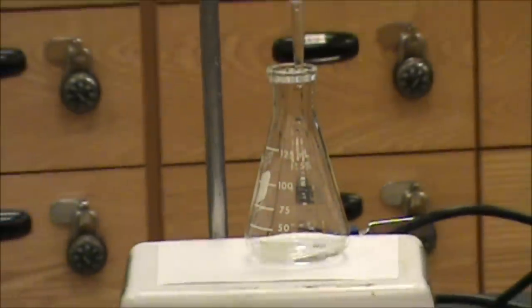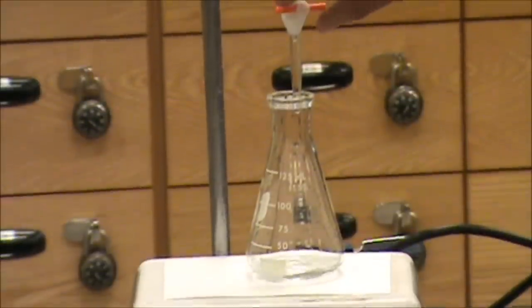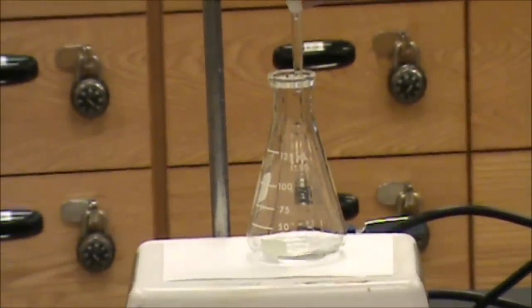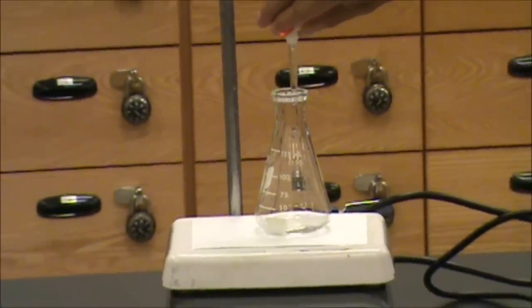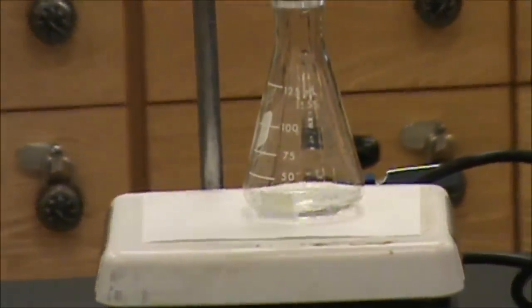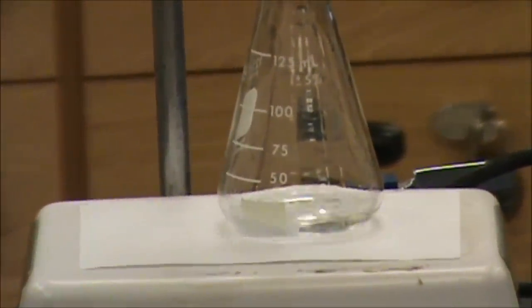I am now going to begin adding the titrant to the analyte. As I add, I'm going to open the stopcock here. And you'll notice as the titrant hits the analyte, there'll be splashes of color. In this case, a purple color.